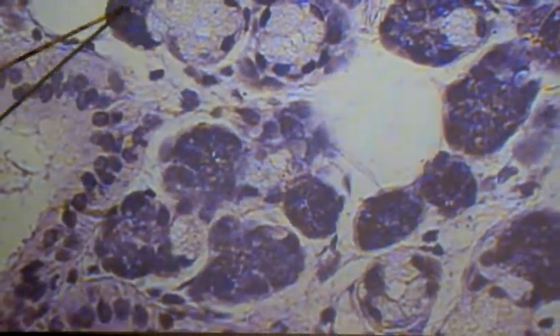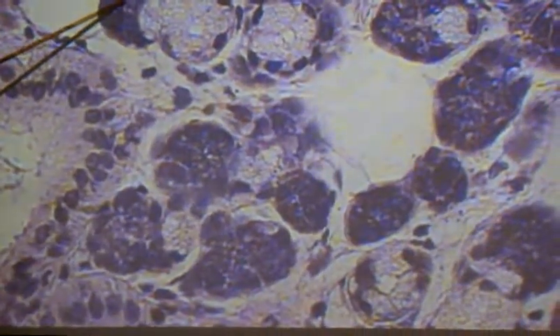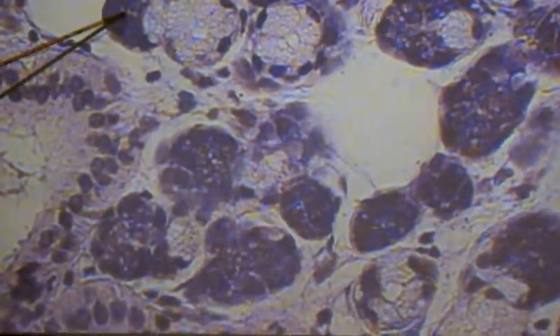Look at this mucous acini right here. Look at this dark crescent — there's a serous demi-lune right there. Mucous acini, a cluster of serous cells that looks like a crescent moon. Now, there's nothing special about these cells; they do exactly the same thing as these. But the early anatomists said, hey, that looks like a crescent moon, let's call it demi-lune. And so they did, and it stuck. But this is just serous acini. That's it.